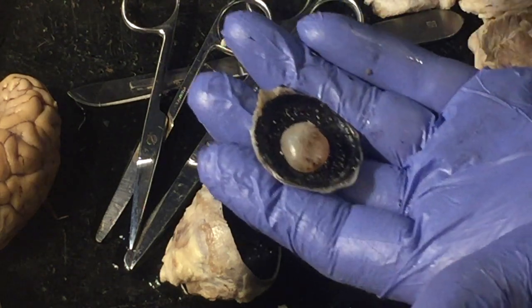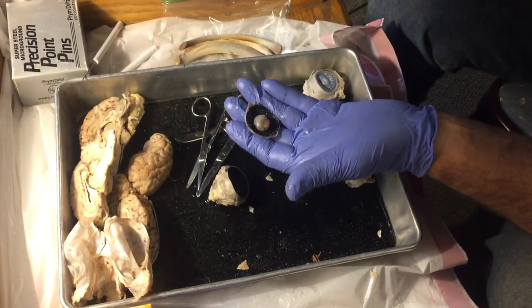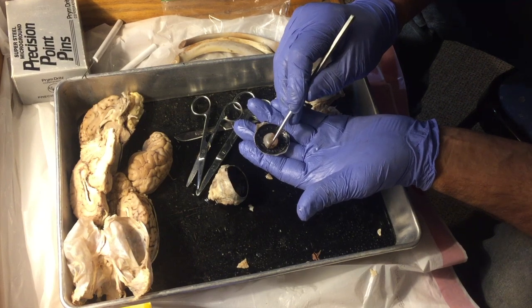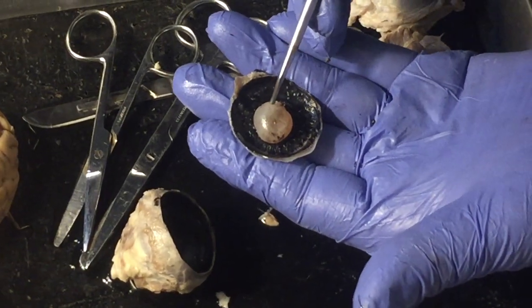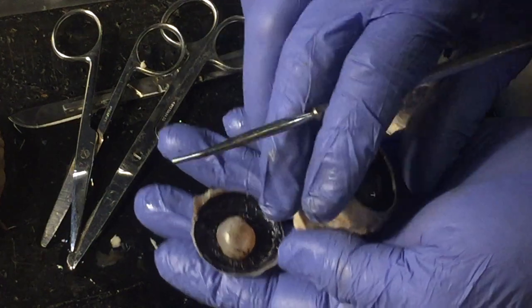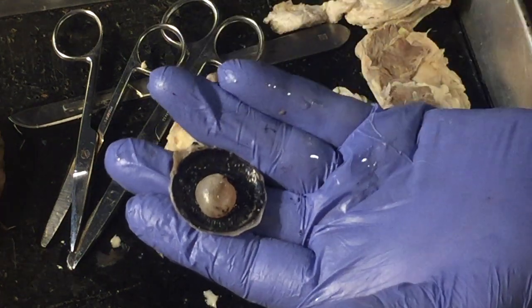They're going to work when you go from looking at something half a mile away to looking at something up close. Your ability to focus on that thing distant and then to focus on something up close and everything in between is dependent on those muscles tugging and relaxing on the lens to change its shape, all for the purpose of focusing whatever is coming through that lens on the back of the eyeball, which is where your sensory organs are.